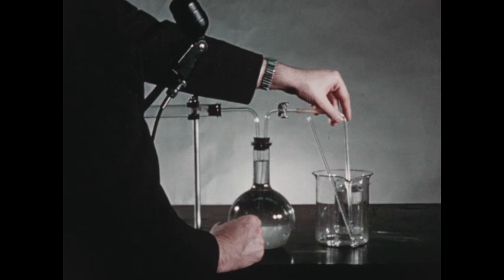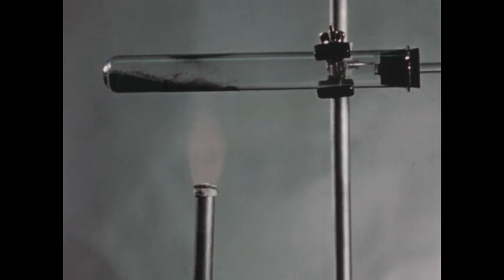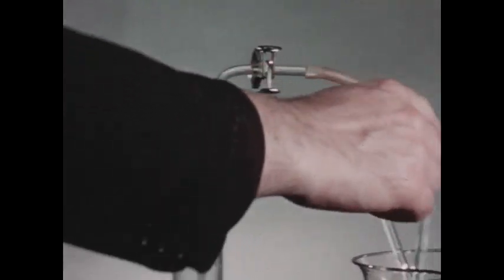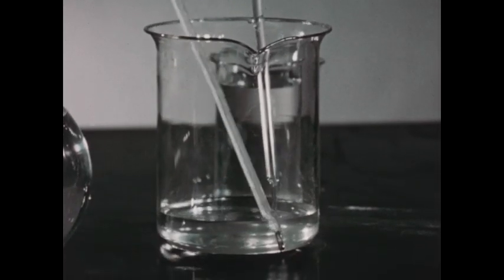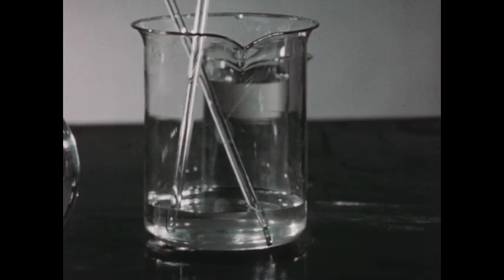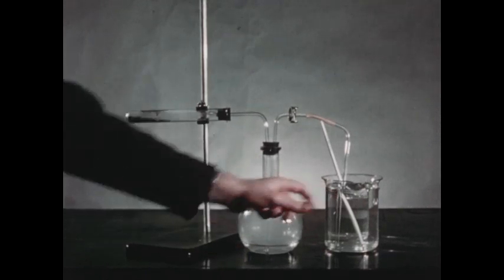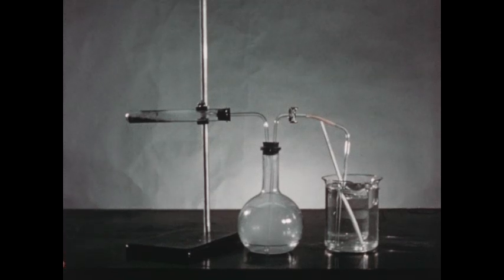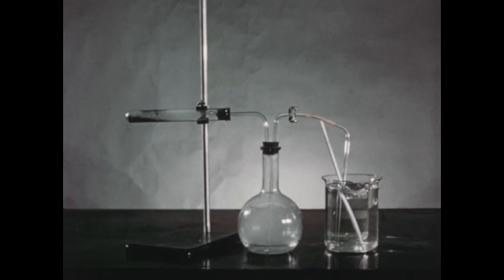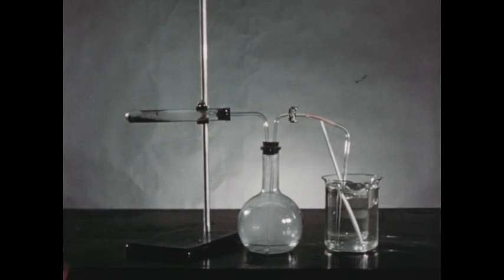We will now light the Bunsen burner and heat the potassium chlorate in the test tube. We're now heating the chlorate mixture. Oxygen is being formed here and passing through this tube. Water is being forced out of the flask and is dripping slowly into the beaker. We will continue this operation until approximately three quarters of the water in the flask has been driven into the beaker. We've now heated the test tube until nearly all of the water has been forced from the flask into the beaker. At this point, we must discontinue heating and permit the test tube and its contents to cool to room temperature, so that any expansion of the air in the tube which occurred at the beginning of the experiment will be counteracted by a corresponding cooling of this air after we discontinue the heating.